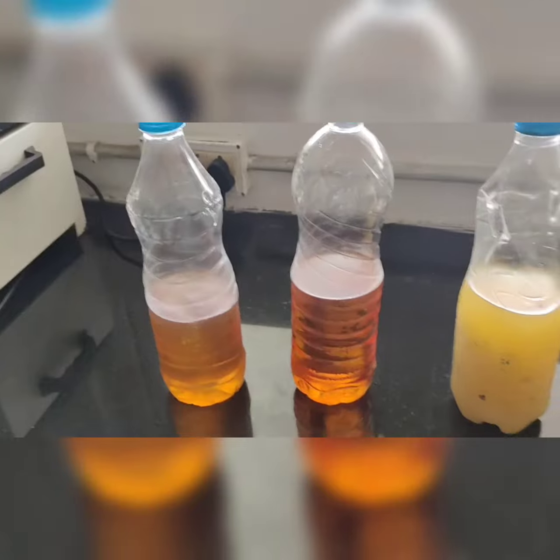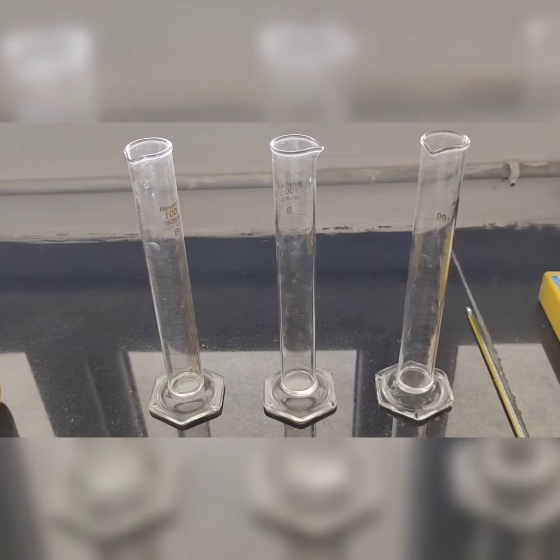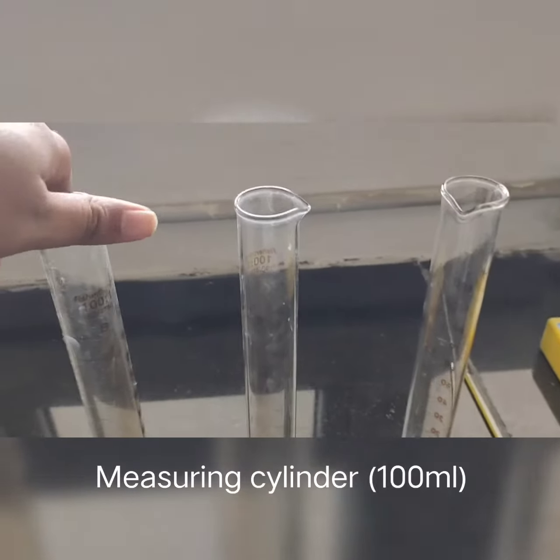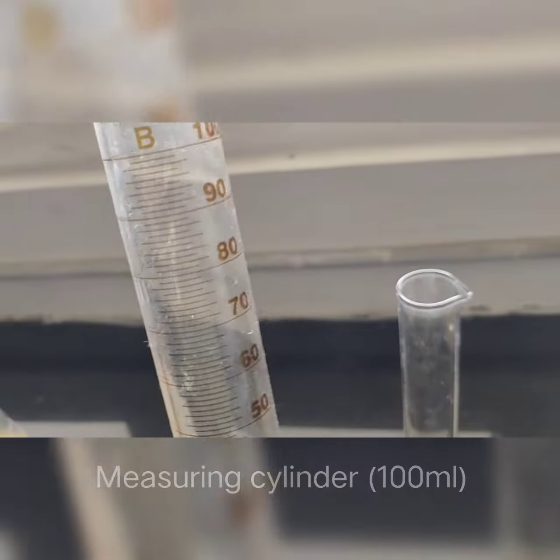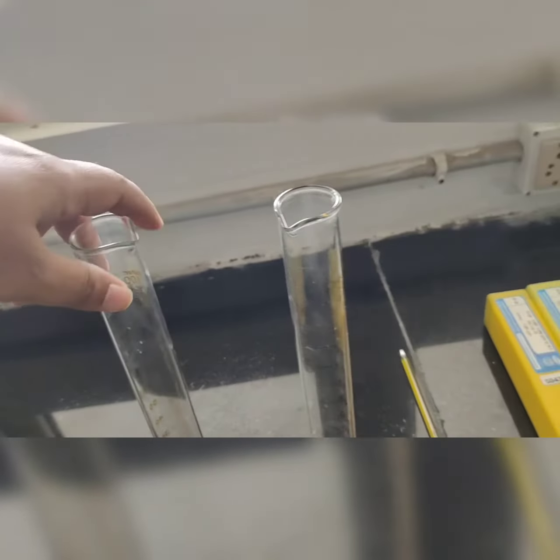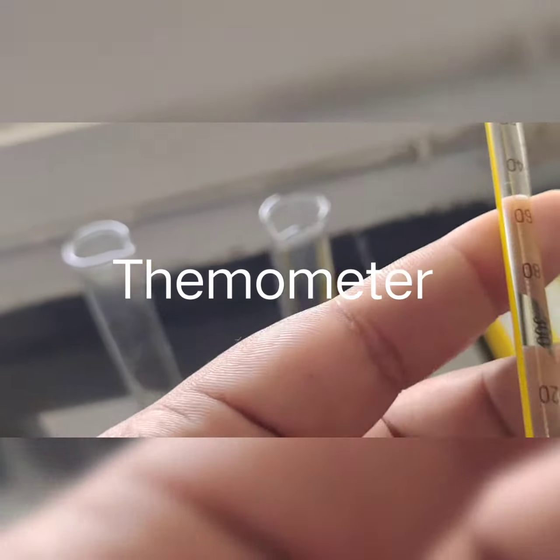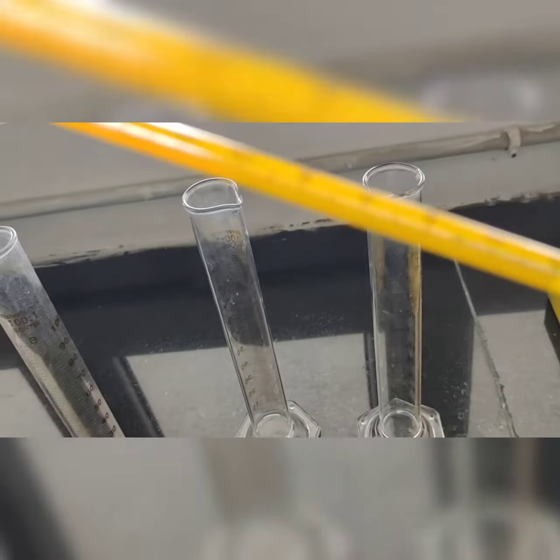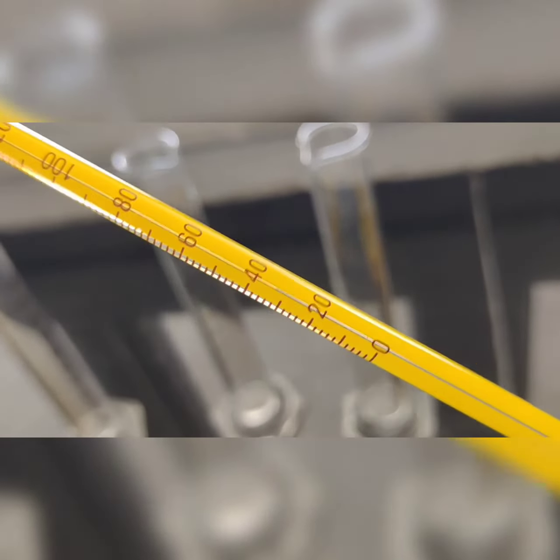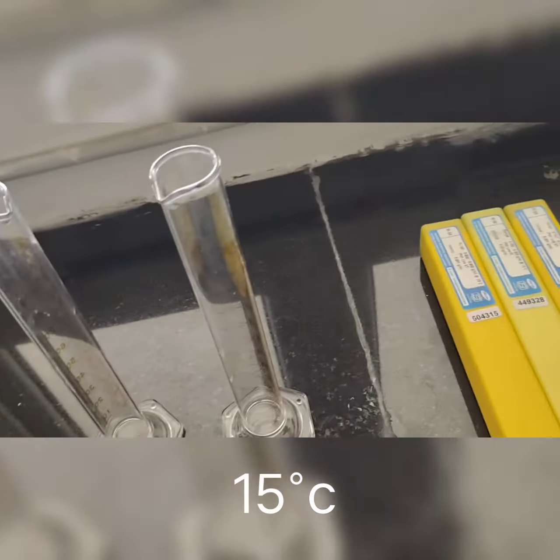Okay. So these are the samples, and the examination is done in cylindrical glass jars. You can take one of 100 ml. For testing the temperature we will be using the thermometer, which has a range from 0 to 100, 200, 300, like that. So between 0 to 20 is the range in which we should be seeing the temperature.